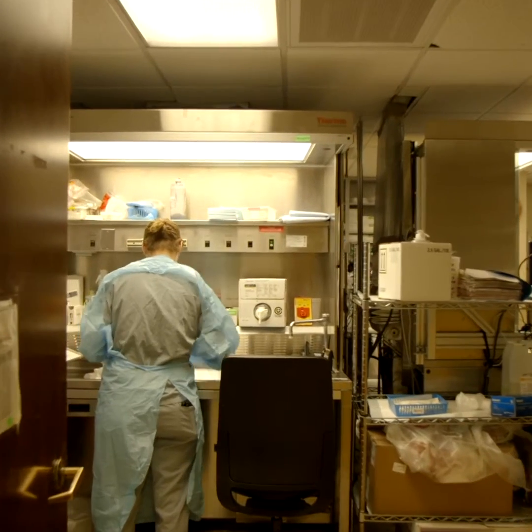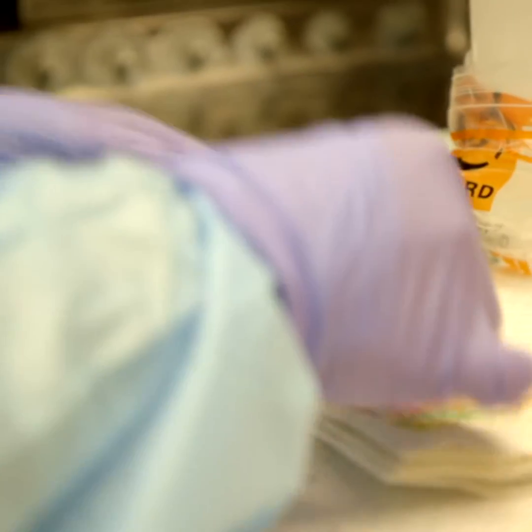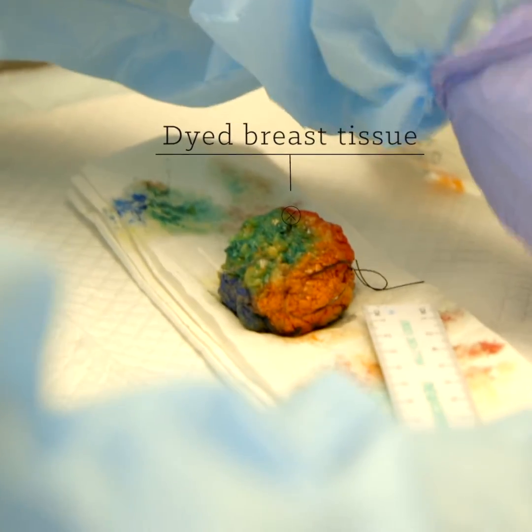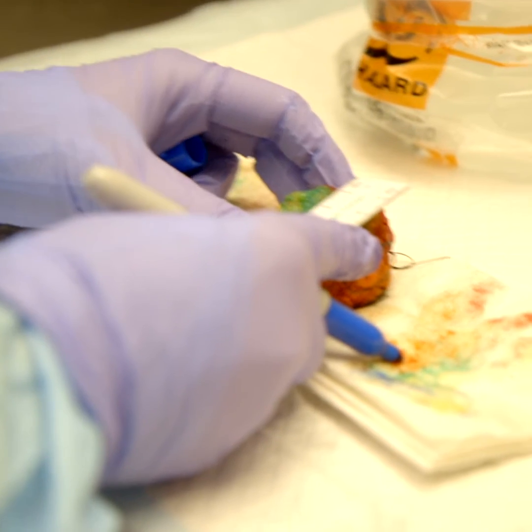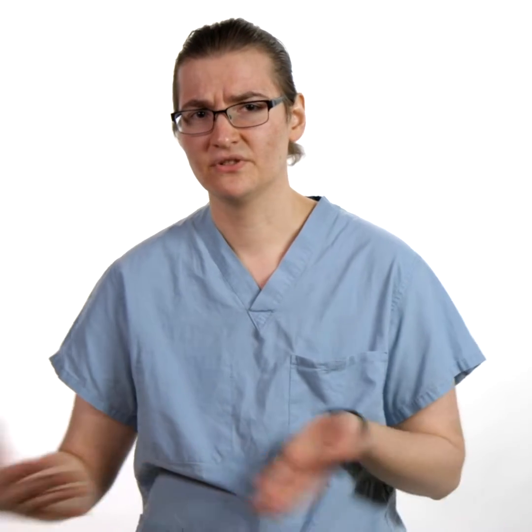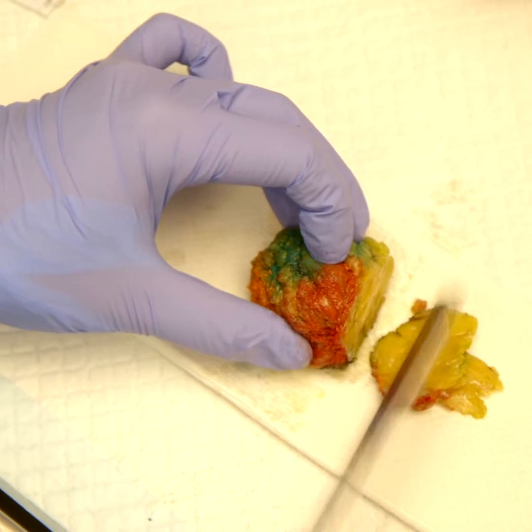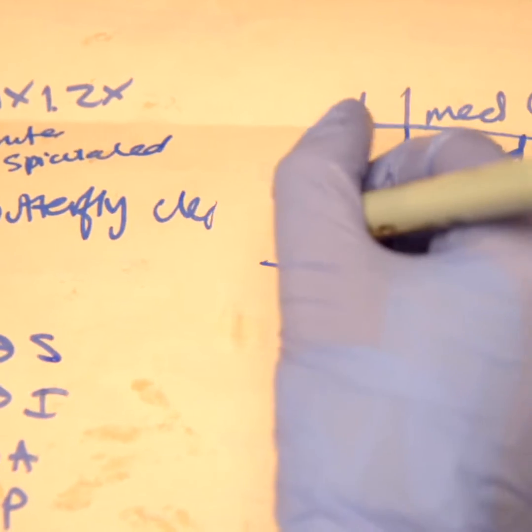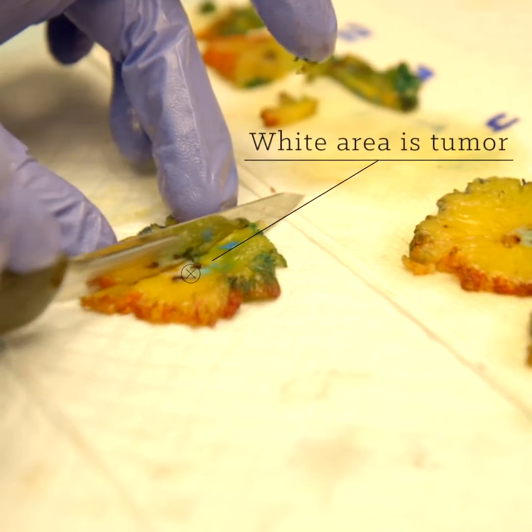I need to go through the specimen and determine what parts are important. I'm describing if there's a tumor or not, the characteristics of the tumor — I describe the colors, if it's tan pink, and I'll measure the tumor. I'll use a variety of tools to further dissect that specimen, making some slices to see how deep that tumor may invade. I'm the eyes of the pathologist, looking at grossly what is happening with the specimen.